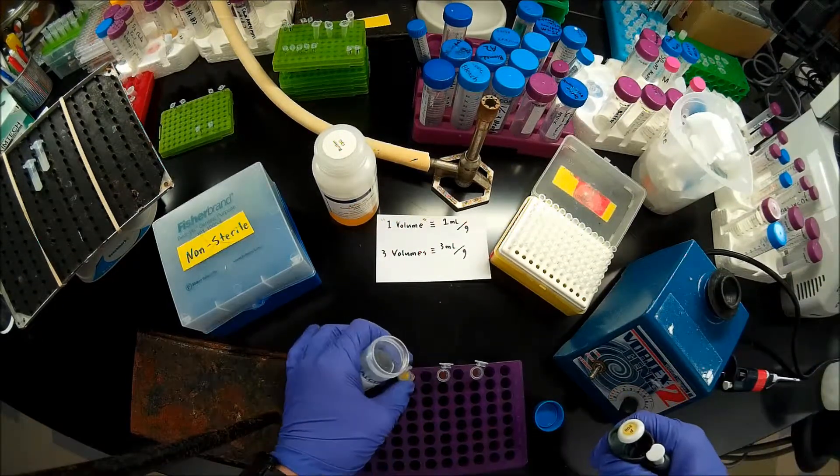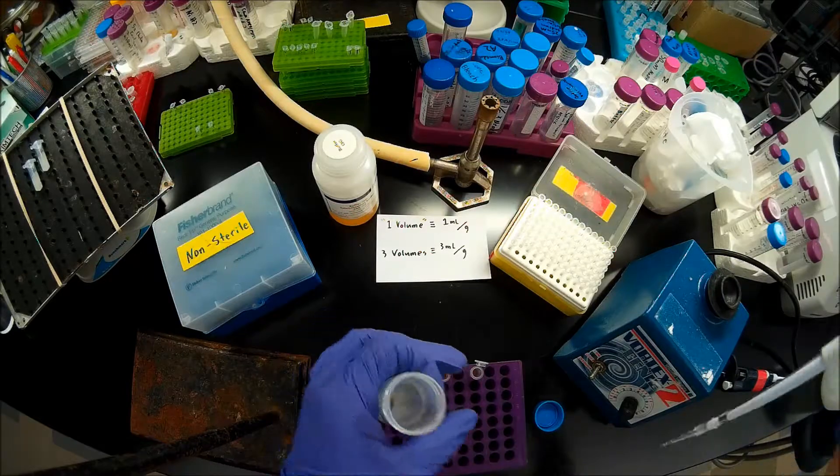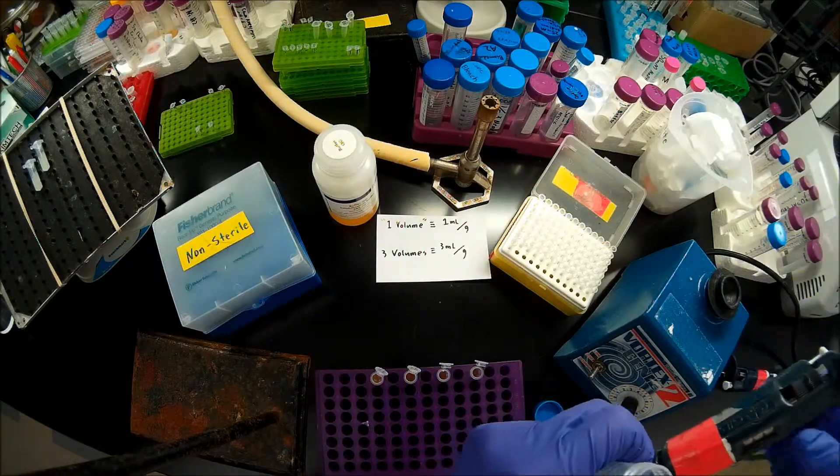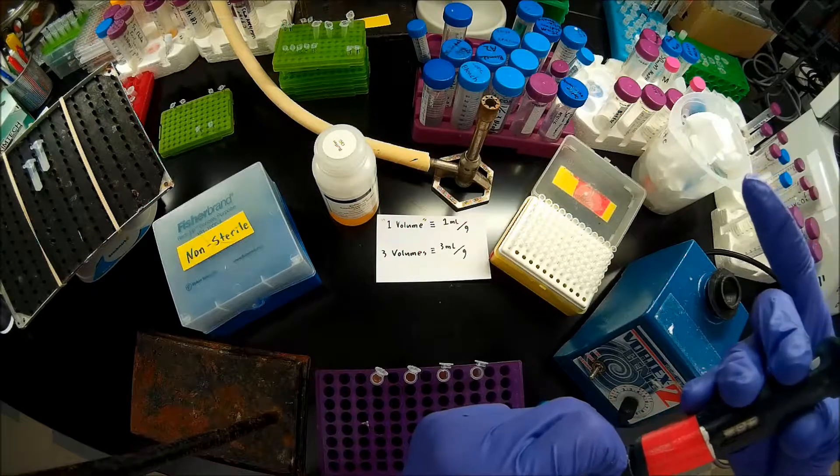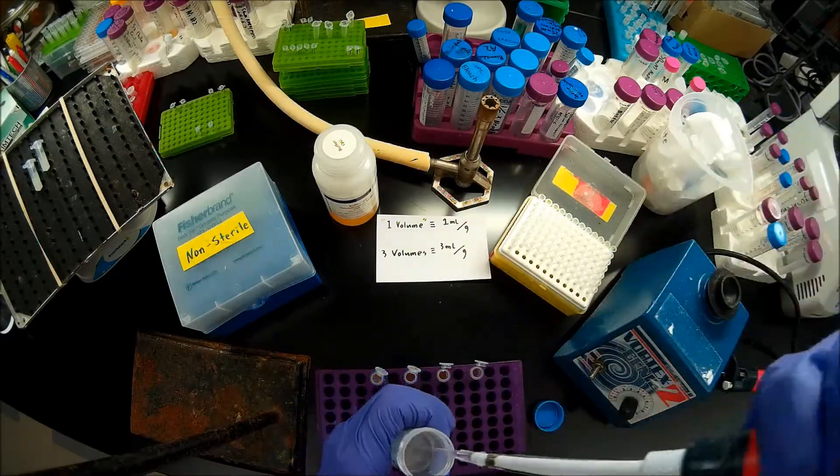This one is 0.10 grams. So, set that to 100 microliters.